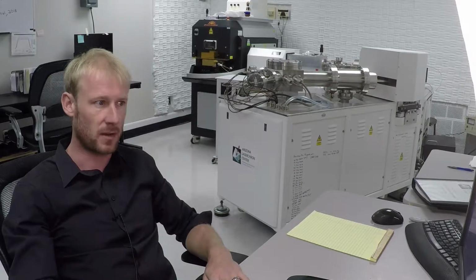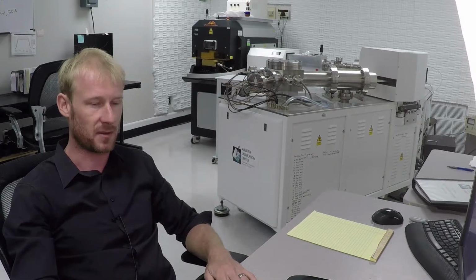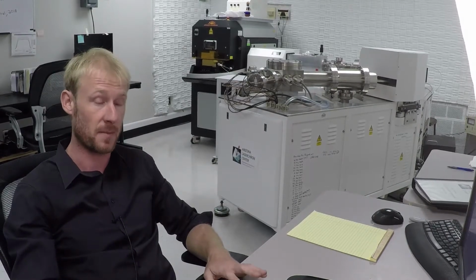That's it for this video. Just a basic introduction on how to upload your data and start the data reduction using MATLAB, the MATLAB interface.